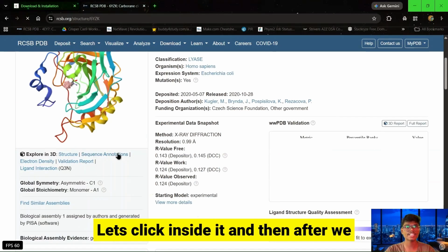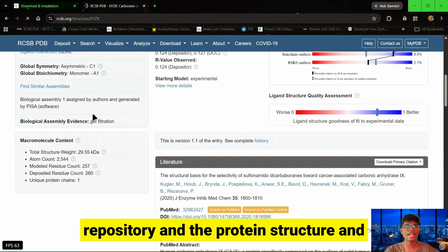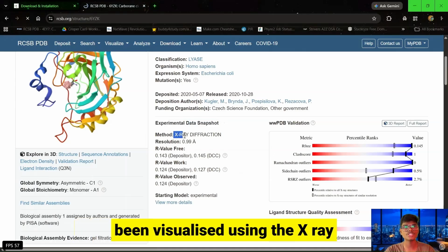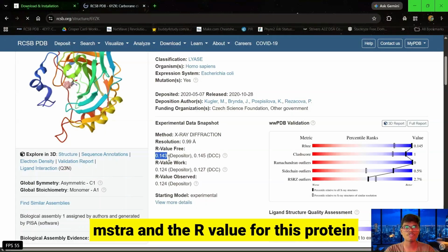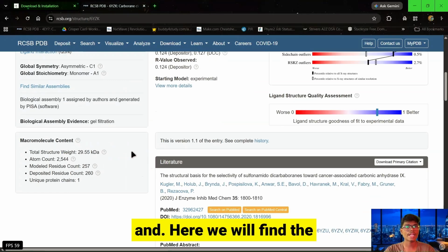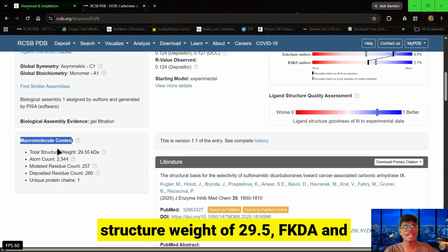Let's click inside it, and then we are going to visualize the whole repository and the protein structure. It includes an experimental data snapshot, that is, this protein has been visualized using X-ray diffraction with a resolution of 0.99 angstrom, and the R value for this protein structure is 0.143, R work is 0.124, and observed is 0.124. Here we will find the macromolecular content, that is a structure weight of 29.55 kDa and more.